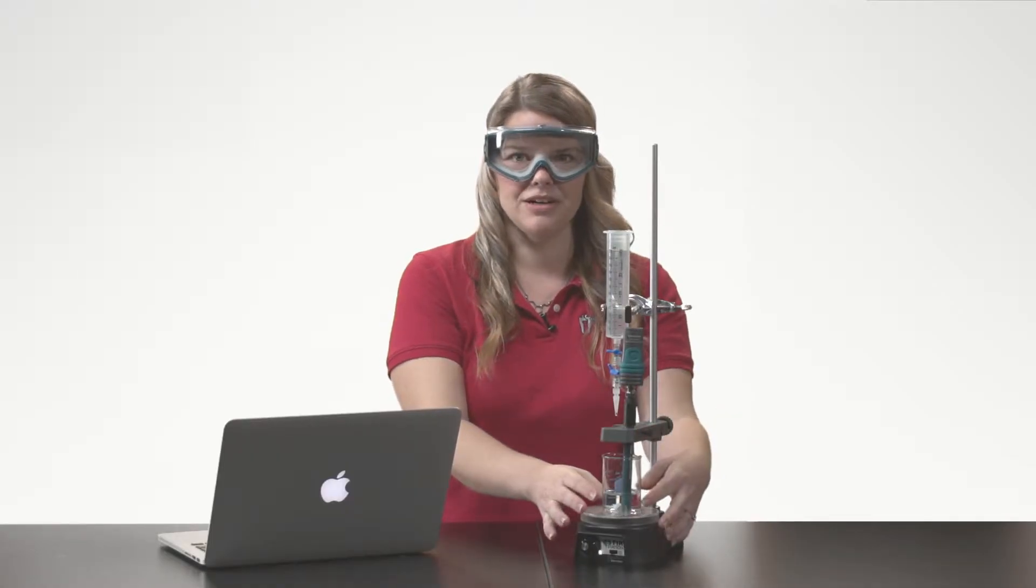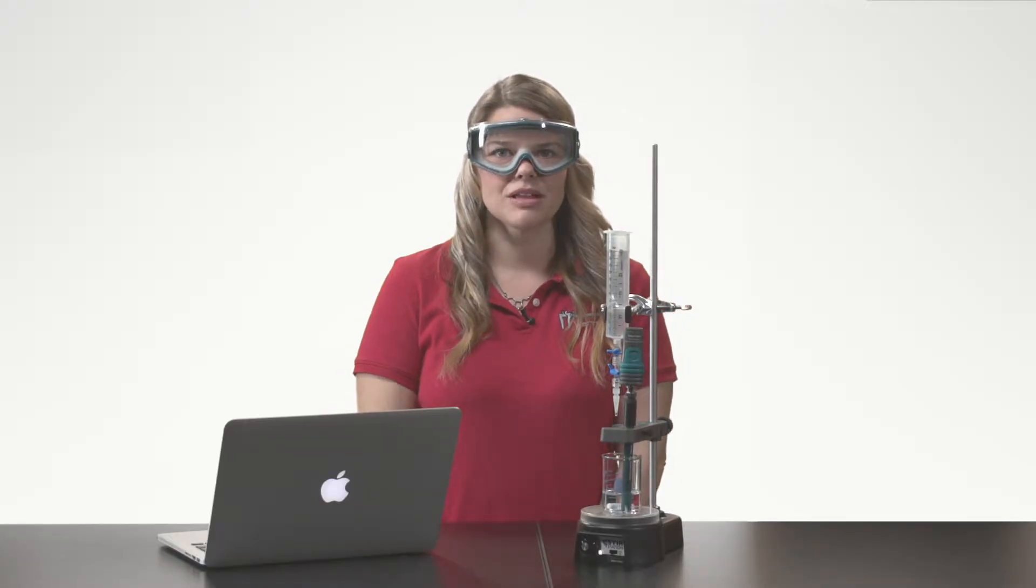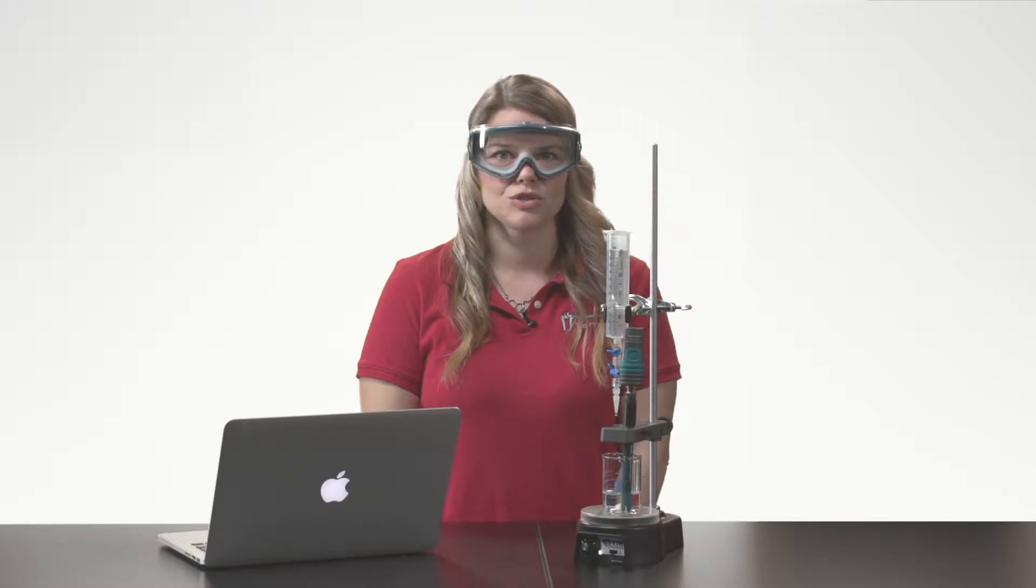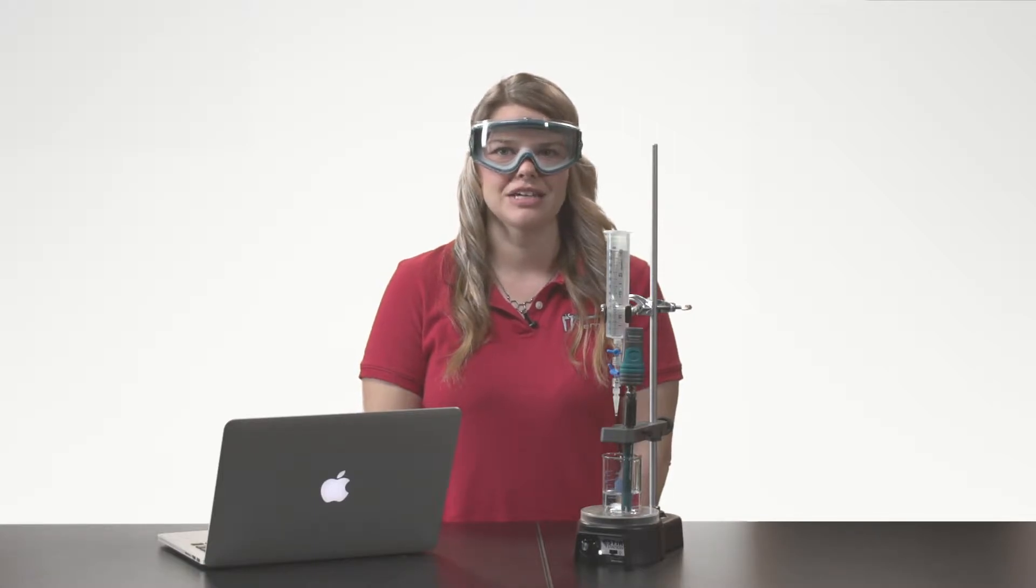In the beaker, I have a magnetic stirring bar, 10 milliliters of hydrochloric acid, and 30 milliliters of distilled water with a few drops of phenolphthalein indicator.